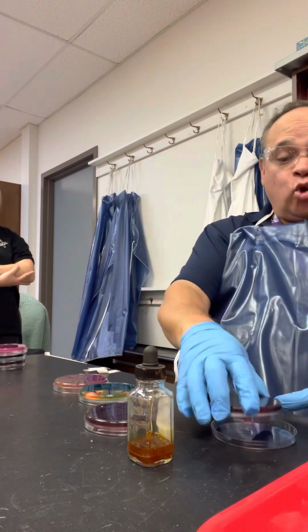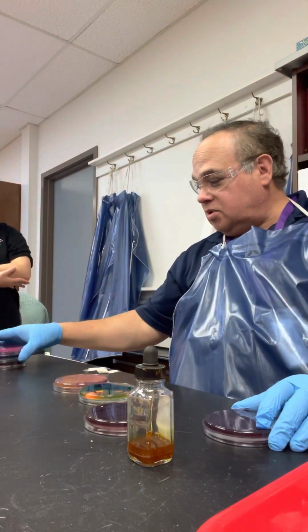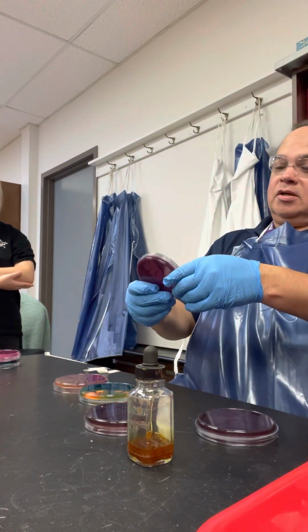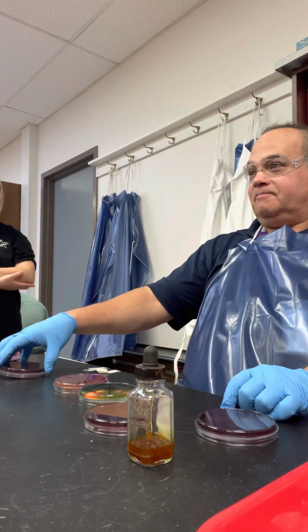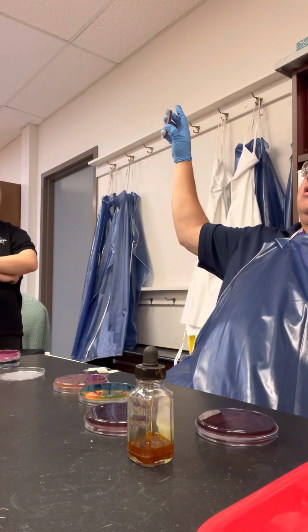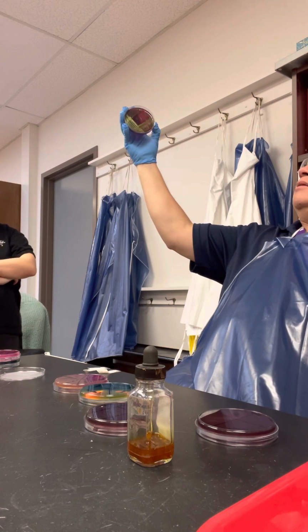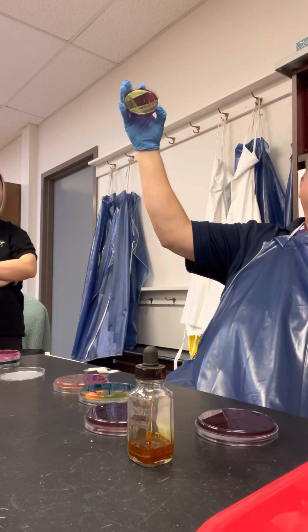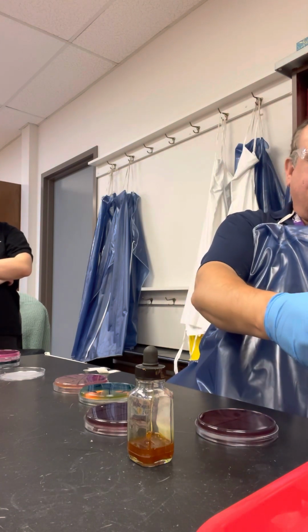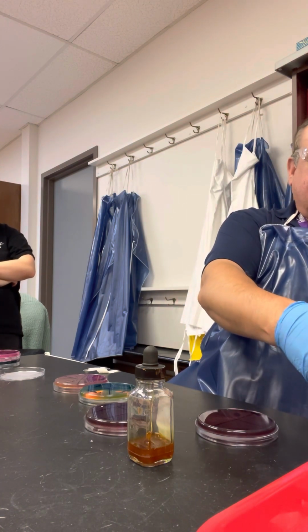Oh yeah, you haven't seen anything yet. Look what somebody did. Adian did this for you all. Look at the beautiful organism on this plate. Oh, that looks really pretty. It's almost matching my nails. But if you look, it is metallic. It's really pretty.